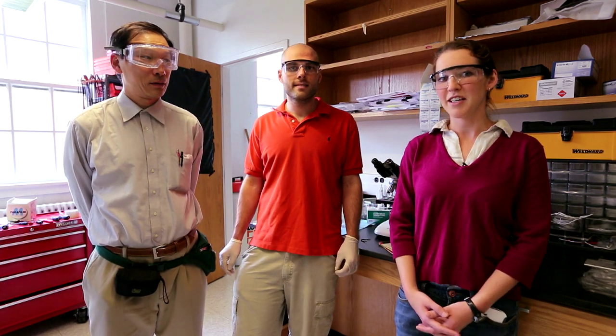So today, my colleagues, Teddy Baker and Dr. Okada, will be showing us how we spin carbon nanotubes in the lab.